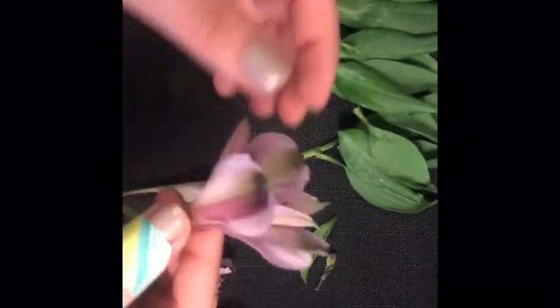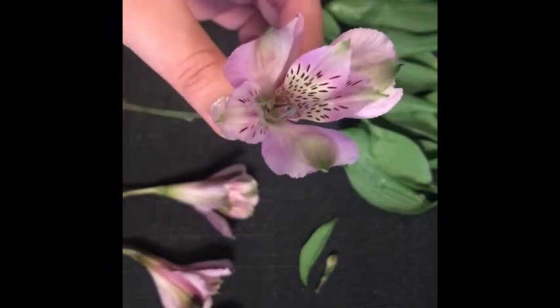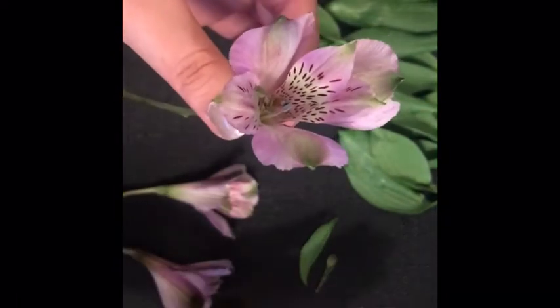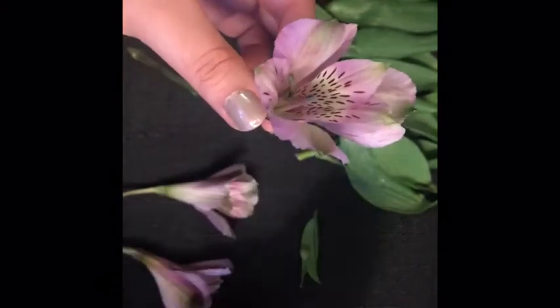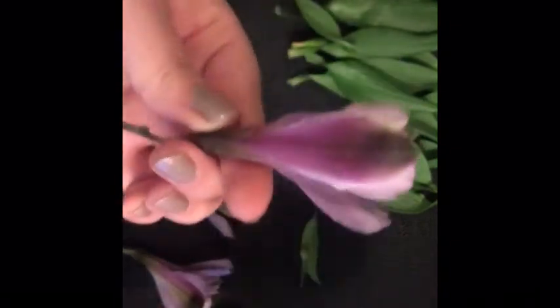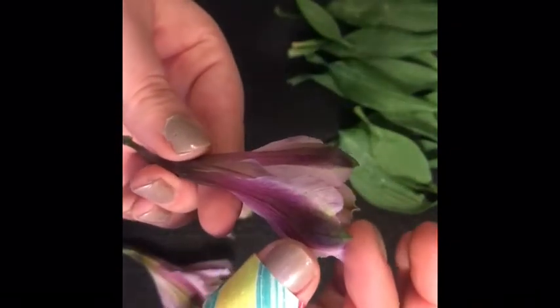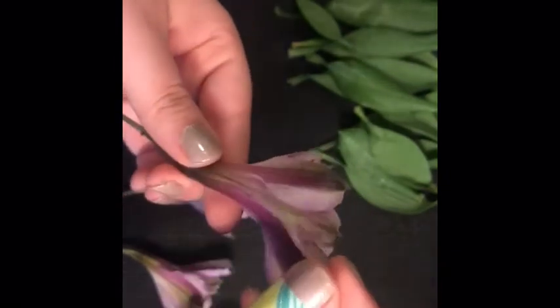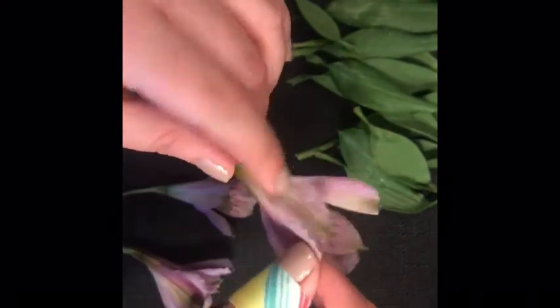In this flower, it might look like there are six petals here, but actually three are part of that sepal that protects the flowers, and three are petals. So if you notice, there are on the outside some quite large, what look like petals with kind of pointy tips here. And if you notice, they're very wide, and that is because they are actually protecting the petals that are inside of it.